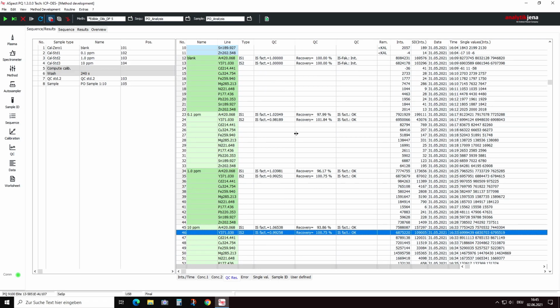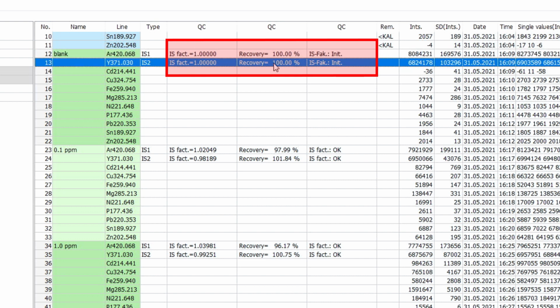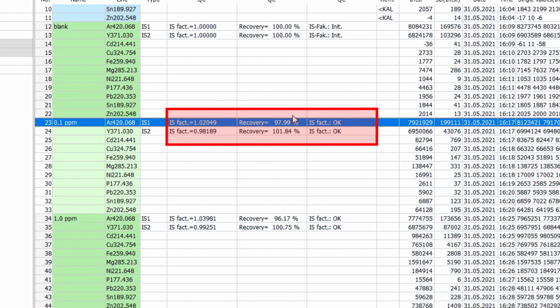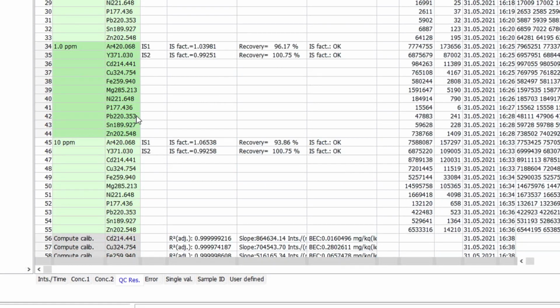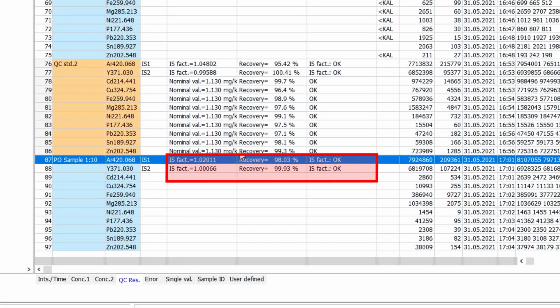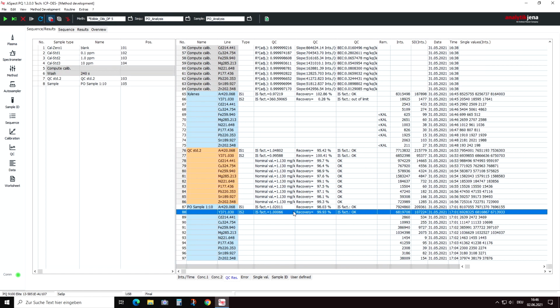The use of internal standards is recommended for more complex sample types, since they can detect and correct for drift effects. Internal standards also provide information if the sample dilutions match the calibration strategy. In ICP-OES, argon is often used as internal standard element, since it can correct for plasma-based fluctuations. Elements that are present in the measurement solutions are able to detect sample transportation-related effects. Typical elements used here are either yttrium or cobalt.